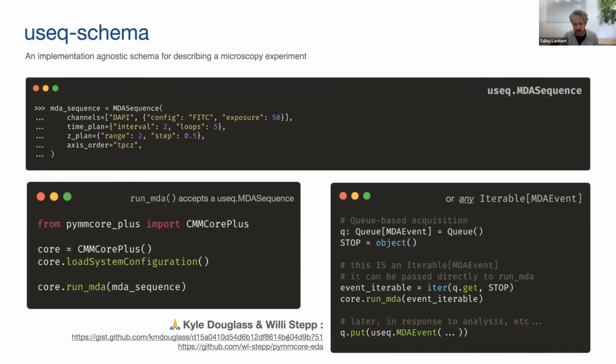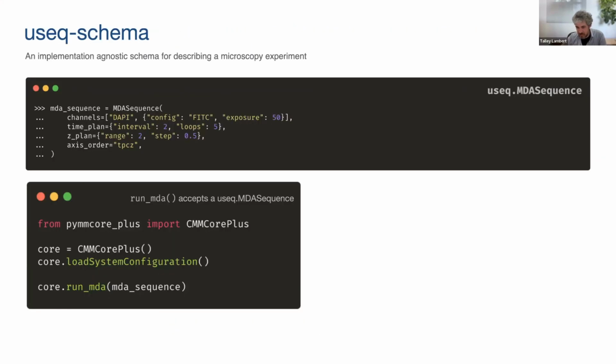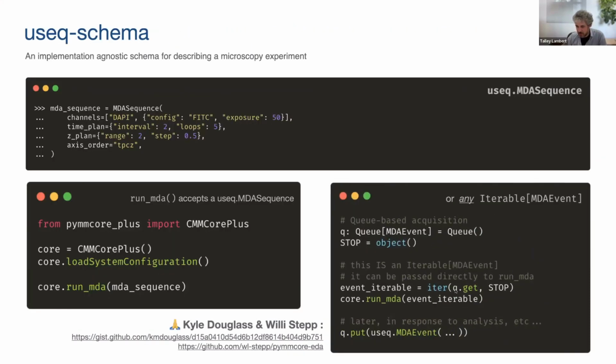So they come from Suliana Manley's lab at EPFL, and they do a lot of event-driven microscopy where, let's say, they're taking an image rarely, and they're looking for an event like a mitochondrial division. And when they spot an event happening using their deep learning models, they want to trigger some sort of change in the acquisition, whether it be imaging faster, zooming in, whatever, right? And so with this pattern here, they can make a queue. They identify some sentinel, some stop object, and this line right here is the magic right here. So by calling iter(queue.get, stop), they're saying, I'm going to make an iterable here of event objects by just popping objects off of this queue until I put onto the queue this special stop object. And without doing anything else, PyMM Core Plus can support that.